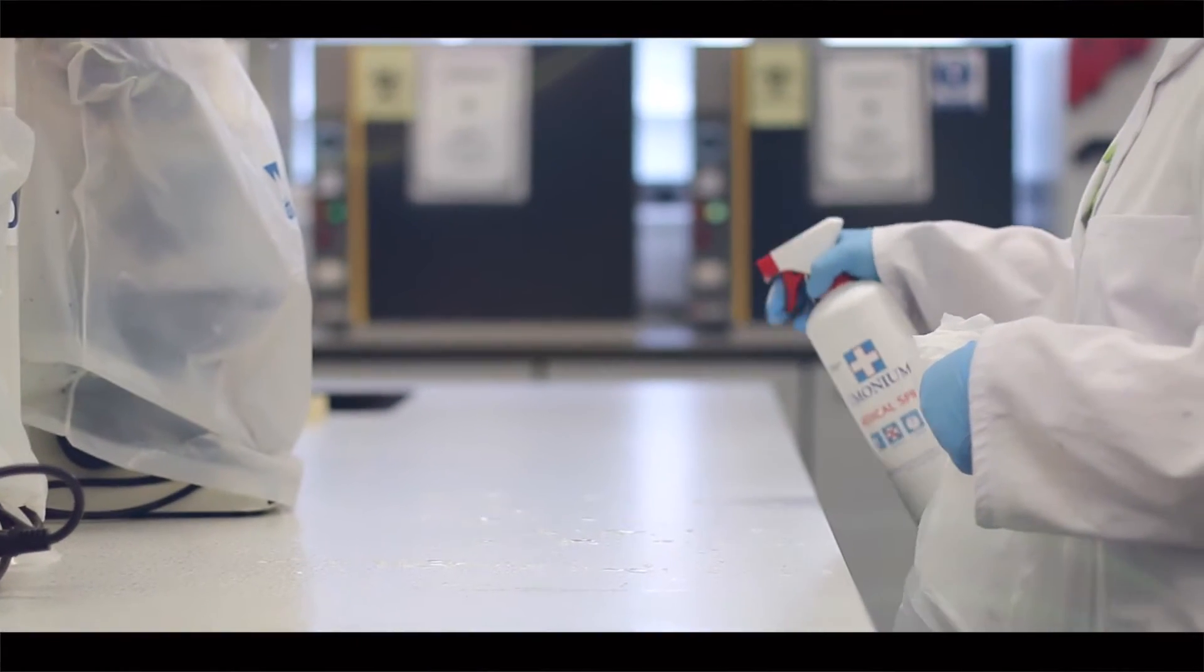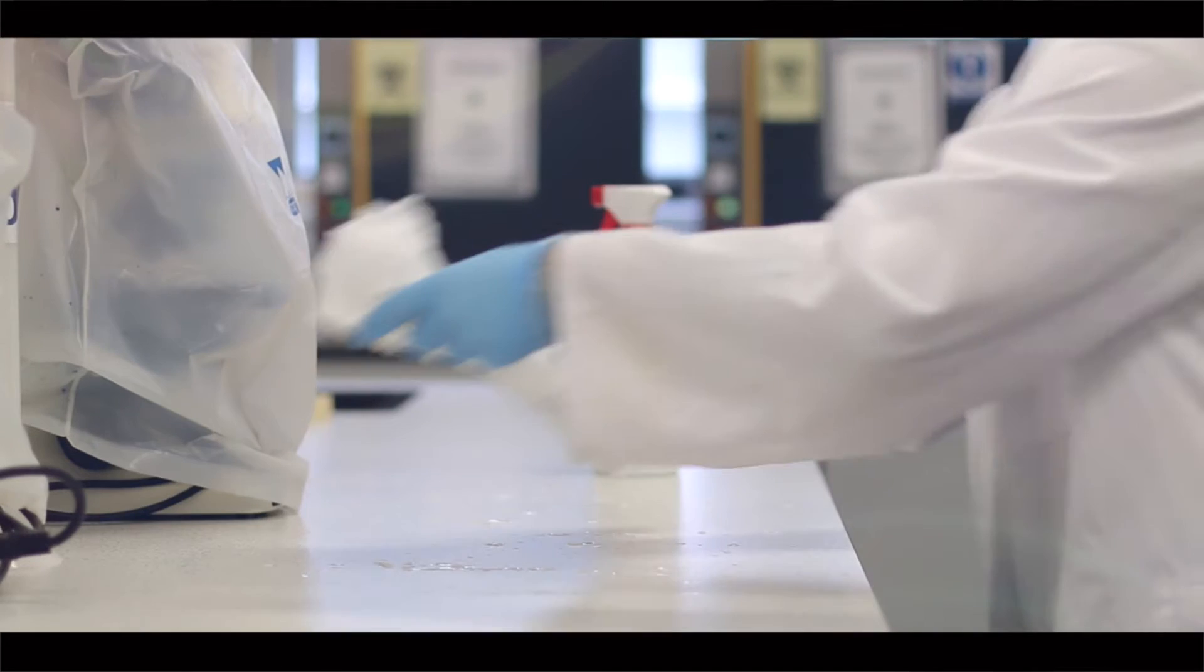Working benches should be absolutely spotless before we even begin placing equipment on them.